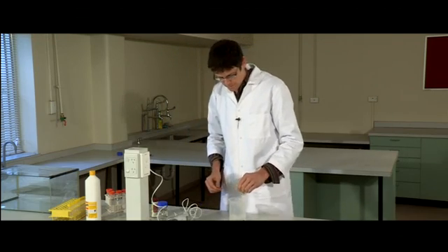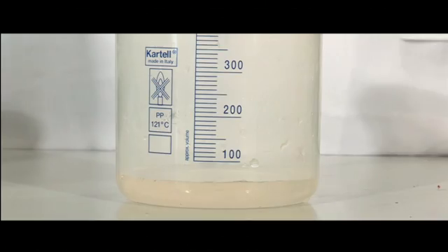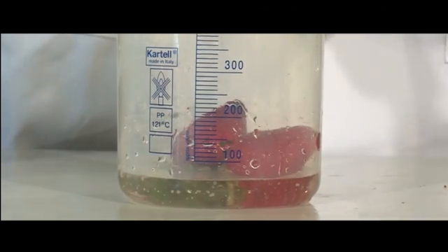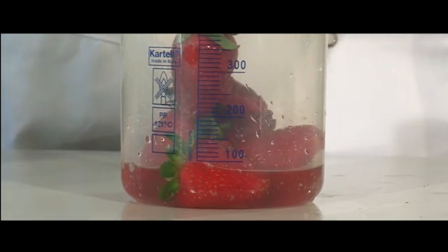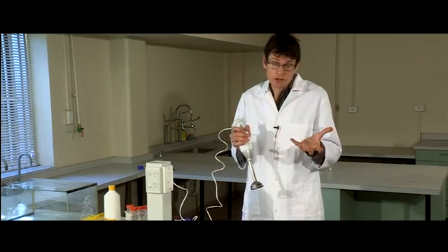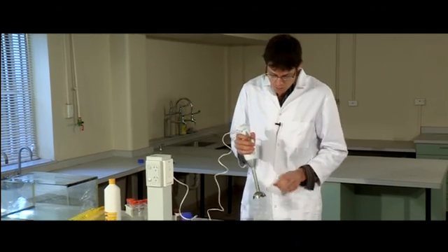Now for the strawberries—chuck them in, leafy bits and all. Keep enough strawberries in there so you get about half the amount of water as you've got strawberries. Get your blender. This just busts open the cell walls of the plant.